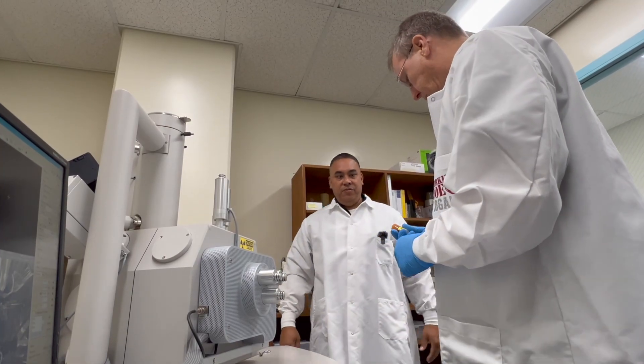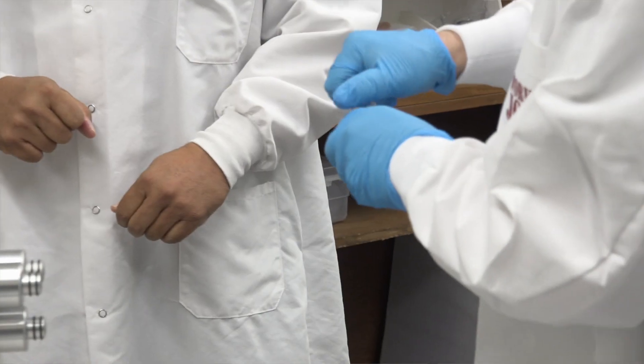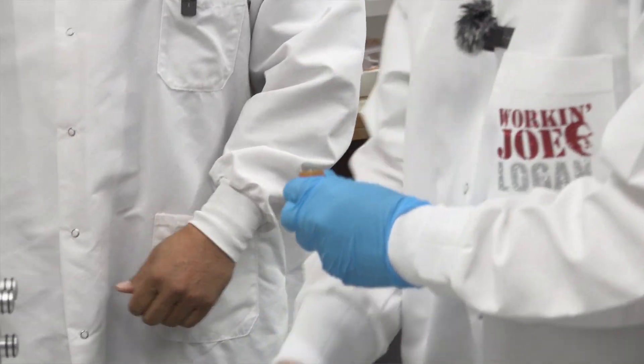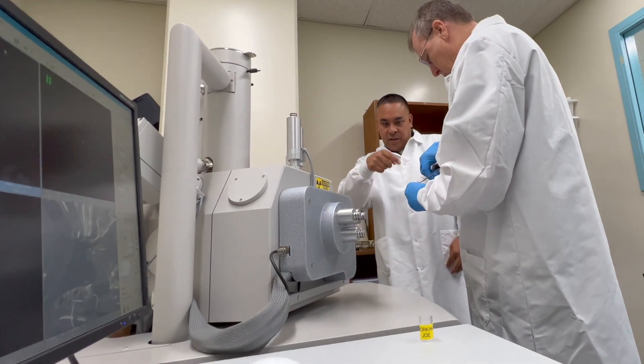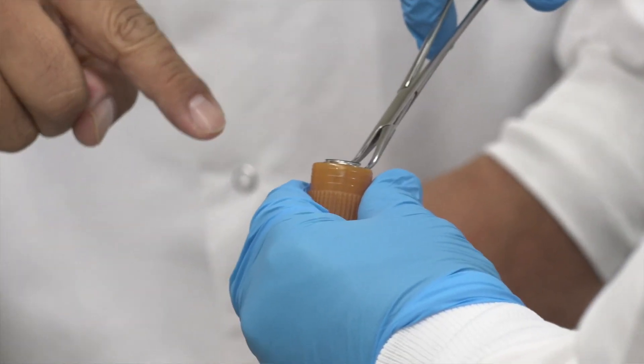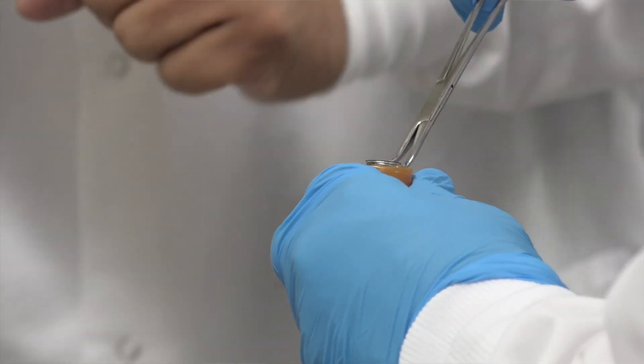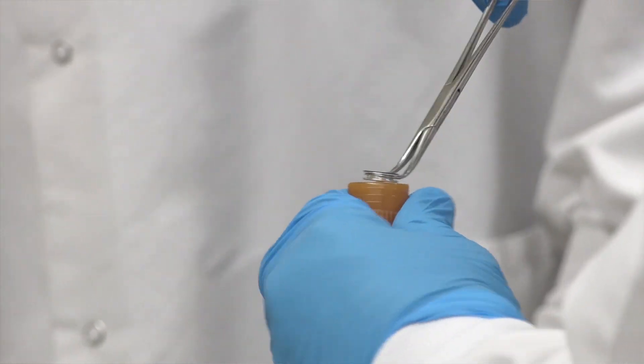Okay, Chief, so what we're going to have you do then is open up the canister there, that stub, and open them up and you're going to reach and try to get on the bottom of that black stub and you clamp it. All right, and then you're going to pull away. Just pull it straight out. There you go.